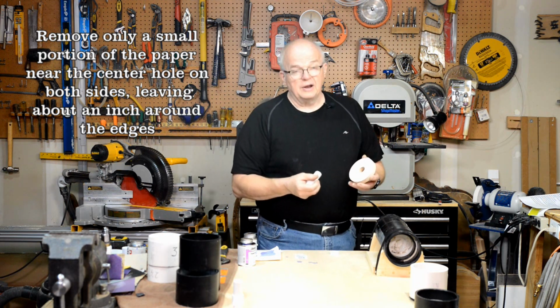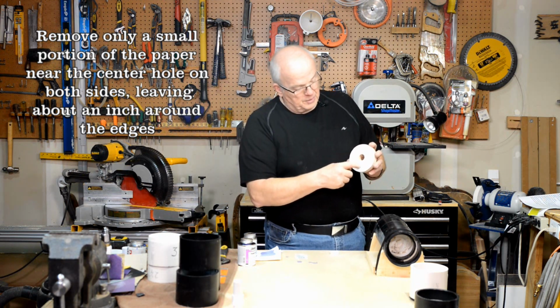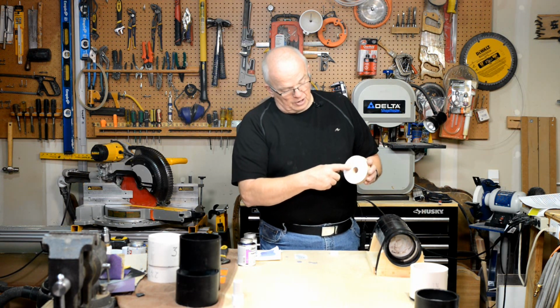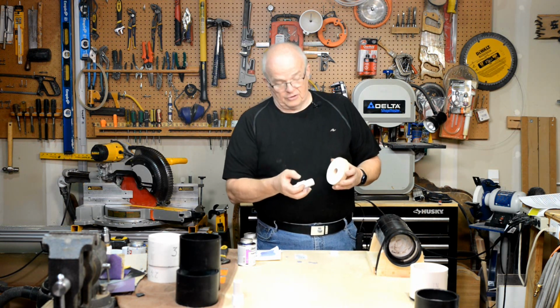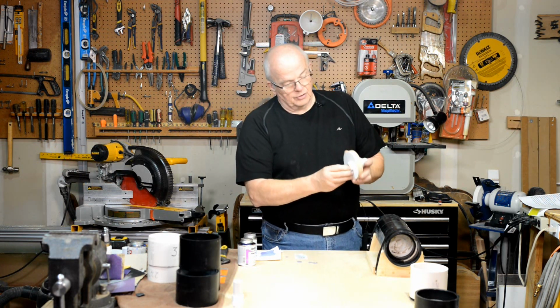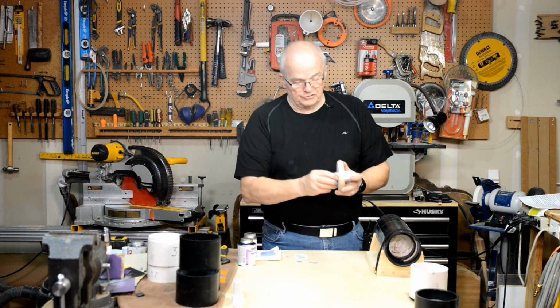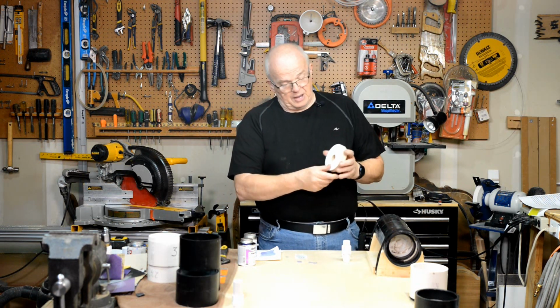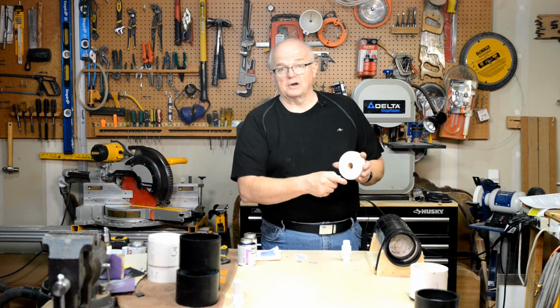So go ahead and pause it here, take that paper off, right around there. You can do the same thing on the other side. You will need it done on both sides because on this side you'll have that in there, and on this side you'll have that piece right there, and that's what's going to seal it all together. So pause it here and go ahead and take the paper off from this piece of acrylic, okay?